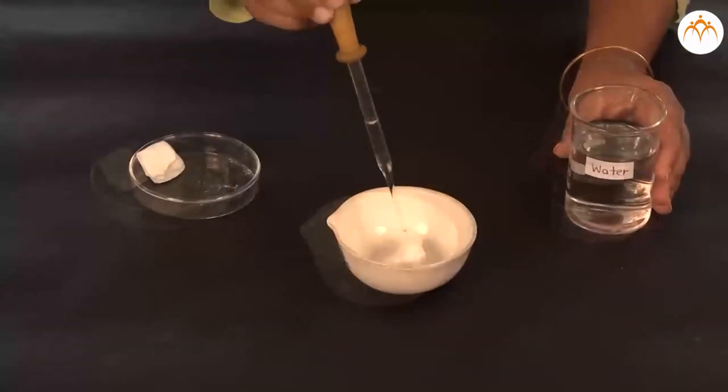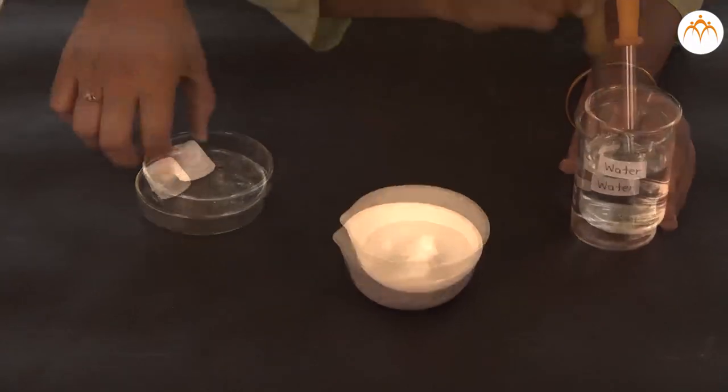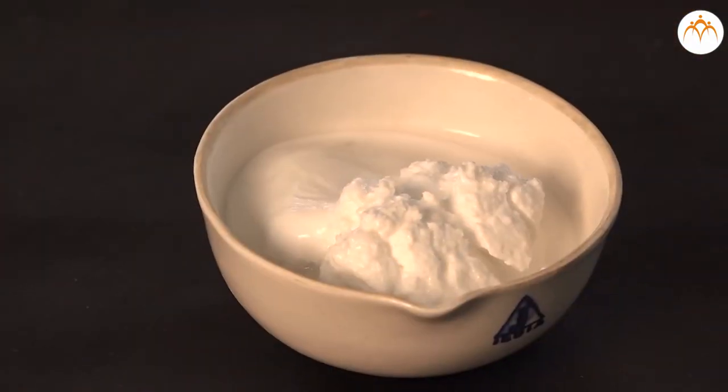Take calcium oxide in a china dish. Add water with it with the help of a dropper. Observe the reaction.